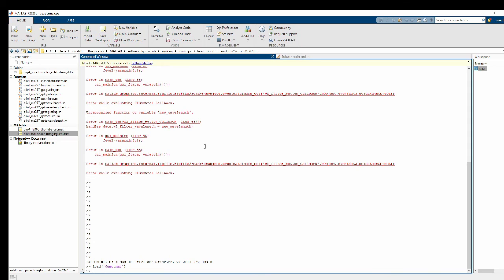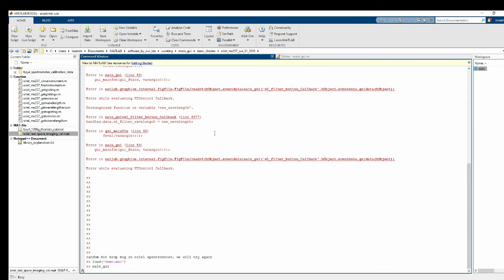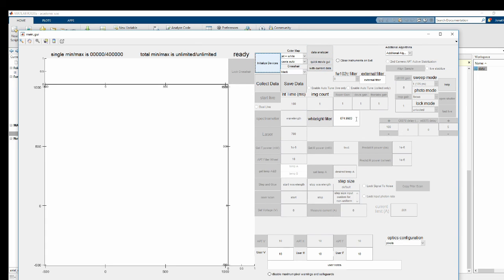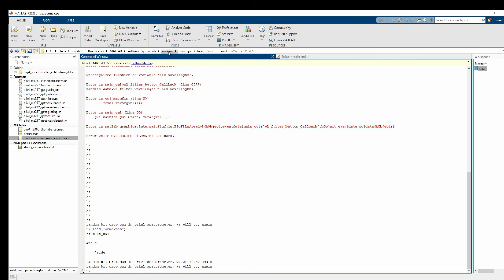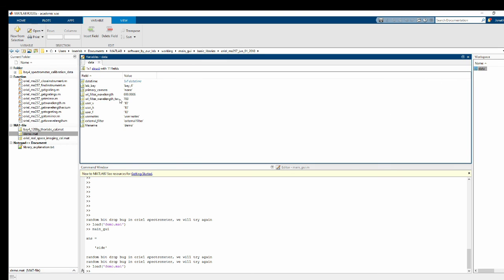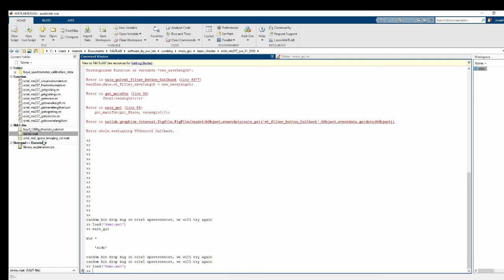So now that should just about do it. Let's run it and see if it works. Okay. And let's say I set it to 700. And now if I save this, don't ever actually save things inside the working software folder, but I'm the one who wrote all this, so I'm allowed to. But I'm going to delete this right after. Okay, and it's got the corresponding numbers saved. Alright, so that's the basics of how to add a device to main GUI.